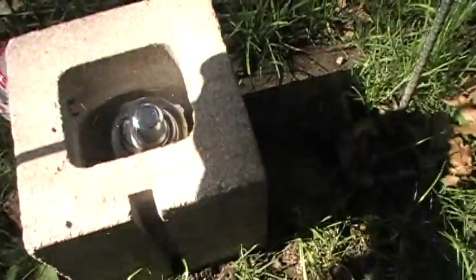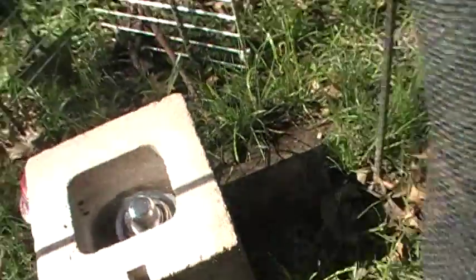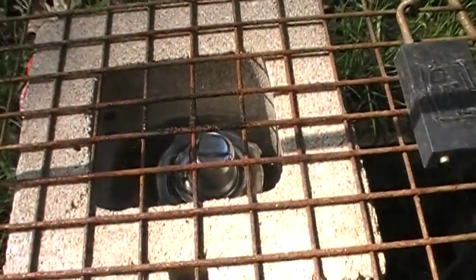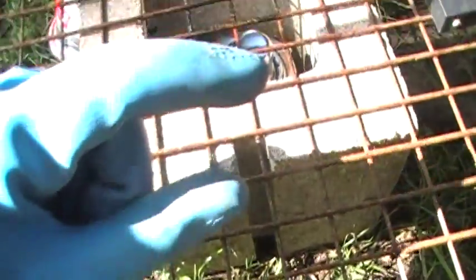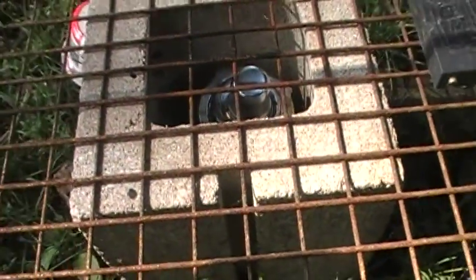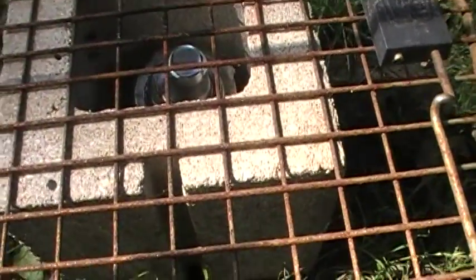Let me show you this. I got this like dog kennel cage that was sitting over on my fence. You put your beaker on top while it's full of hydrogen peroxide and just let it sit there for several hours. When you come back out it should be down quite a bit — just a little bit left in the beaker. I suggest a beaker because a flask would kind of trap most of the evaporated water, so just use a beaker.